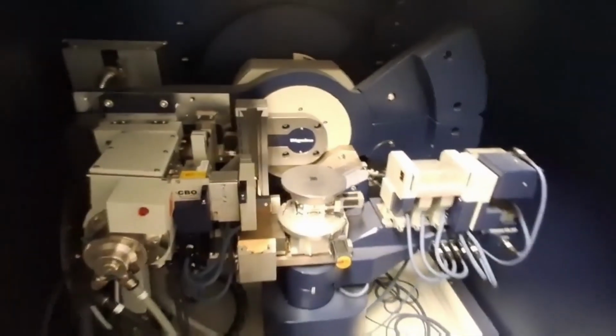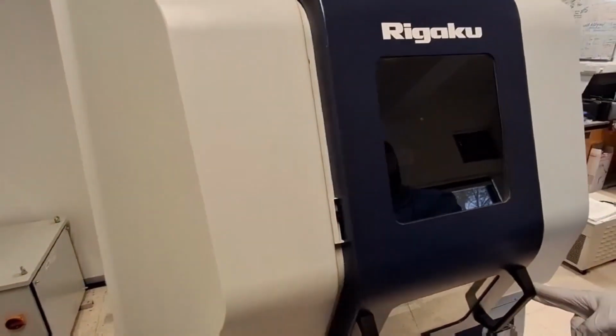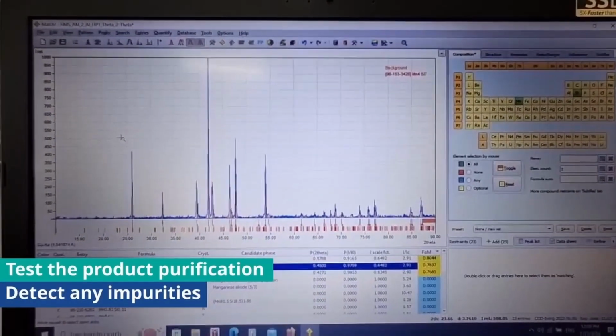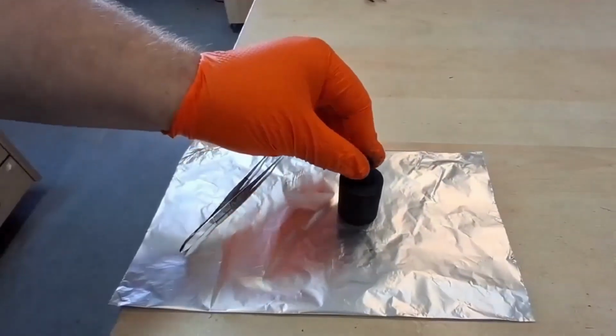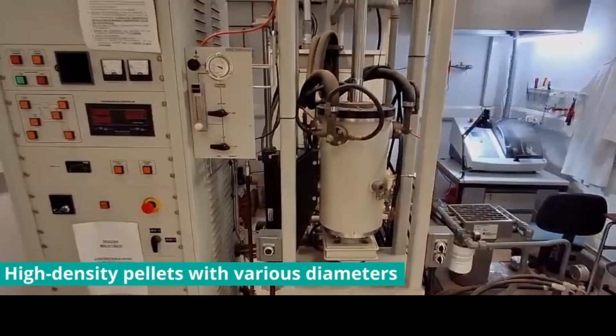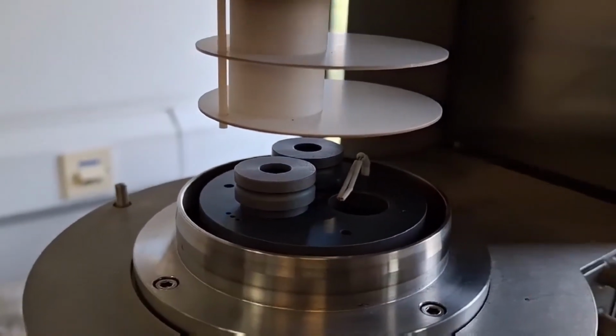At the end of the synthesis process, powder X-ray diffraction analysis is performed to test the product purity and quality. After the validation of the desired silicide phase, high-density pellets of various diameters are fabricated by hot press sintering. Then, thermoelectric characterization is realized.